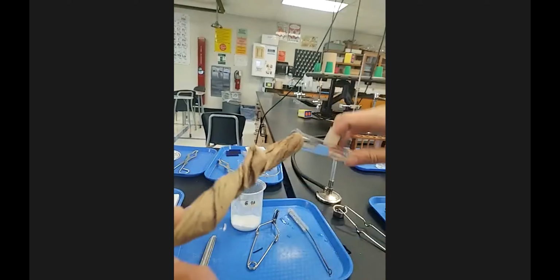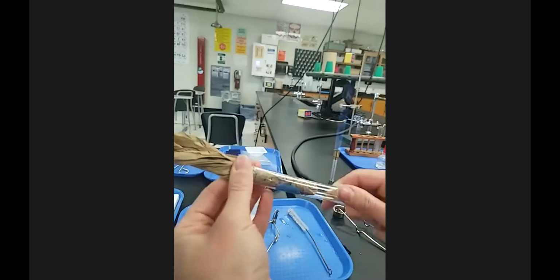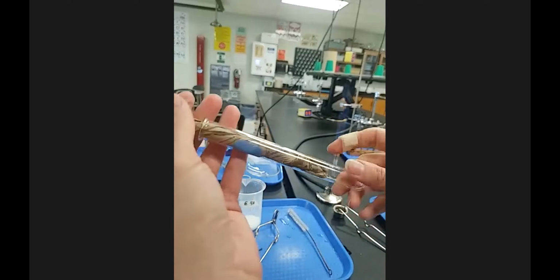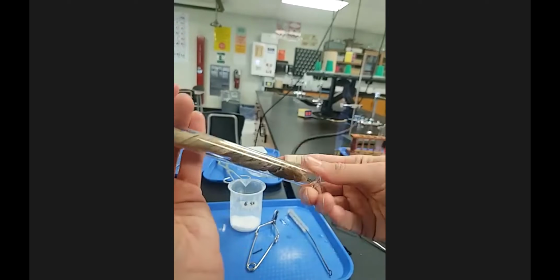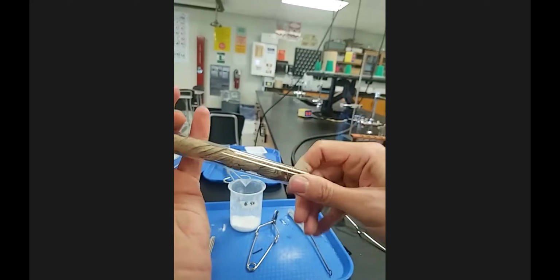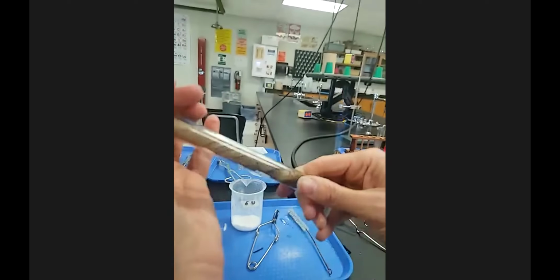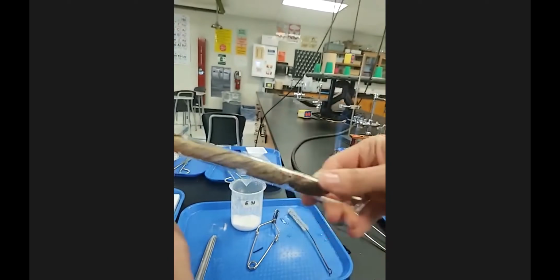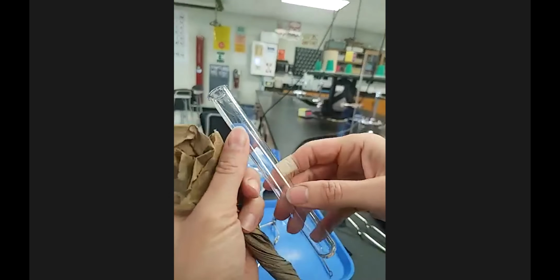And then you kind of have to push and twist the paper towel down into the test tube, but a narrow piece of paper towel will go down very easily. And then as you swirl it, it will cover all the insides and dry out your test tube, and it'll make it nice and clean and dry. So you just really push down to get the bottom. You can see that it's wet, it's at the bottom, and then pull it out. Now, this still has a little bit of water.